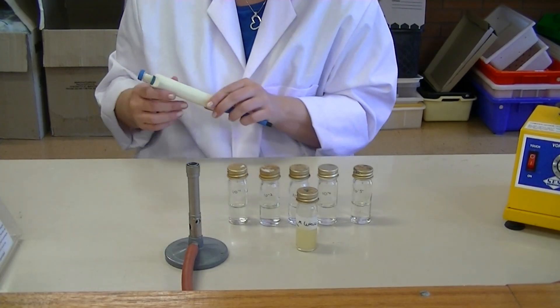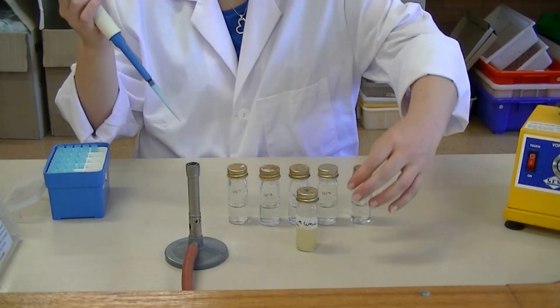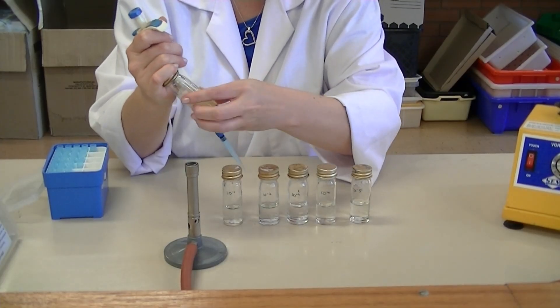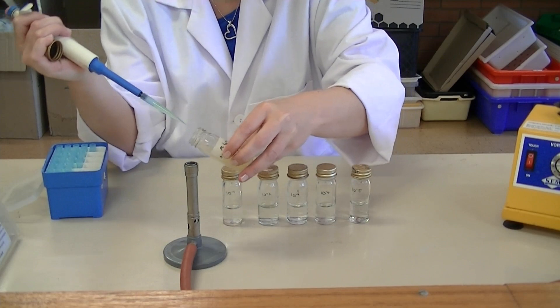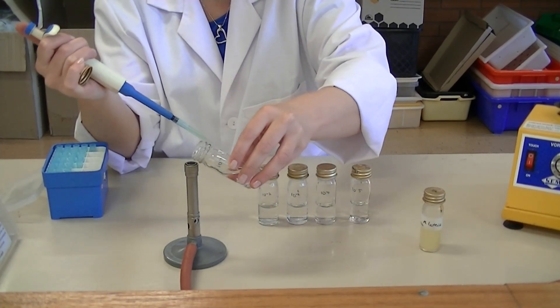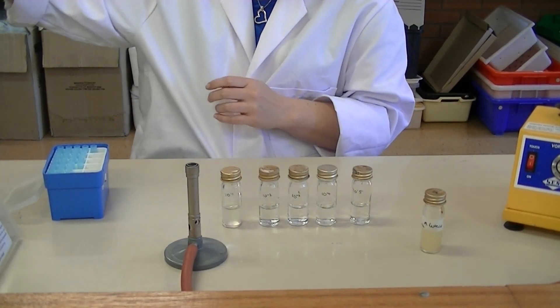You also need your blue tips — the blue tips go with the pipette that measures 1000 microlitres. Pop a tip on to your pipette and then, working aseptically, transfer 1 mil of the stock culture to the first bottle to create the 1-in-10 dilution. Using the crook of your finger, loosen the lid of the bottle, flame the neck of the bottle, collect 1 mil, flame the neck again, replace the lid, then remove the lid of the 10⁻¹ bottle, flame its neck, transfer the 1 mil, flame the neck, and replace the lid. Eject your pipette tip into the pipette bucket.